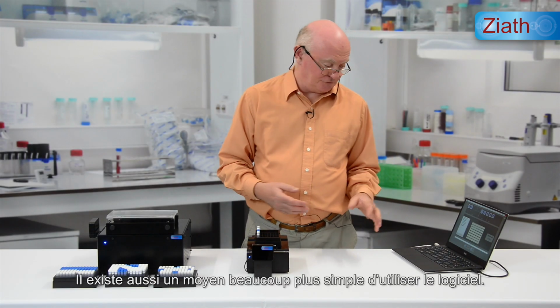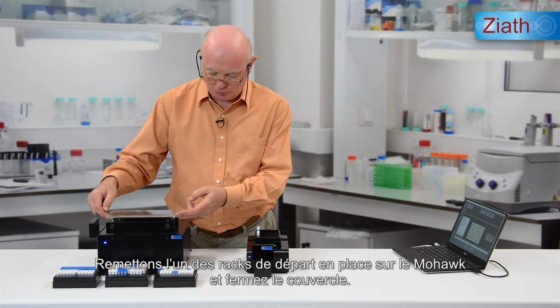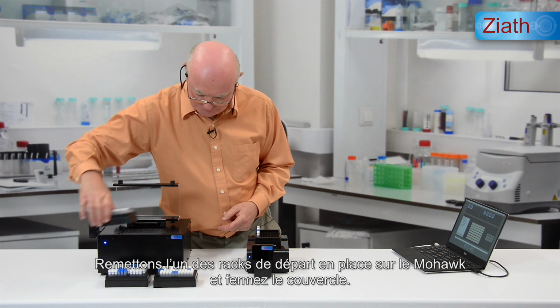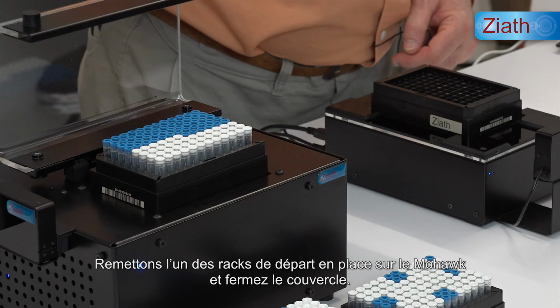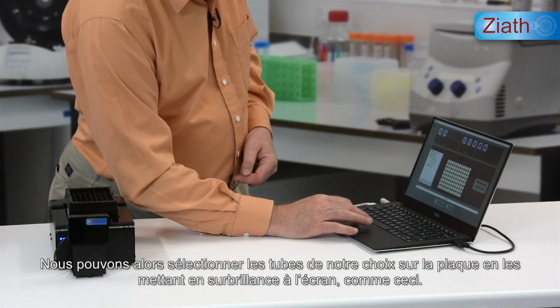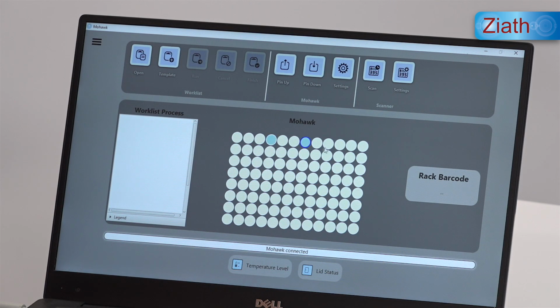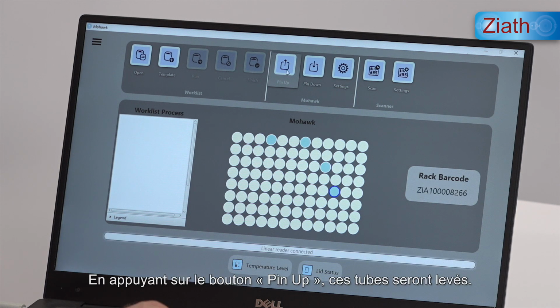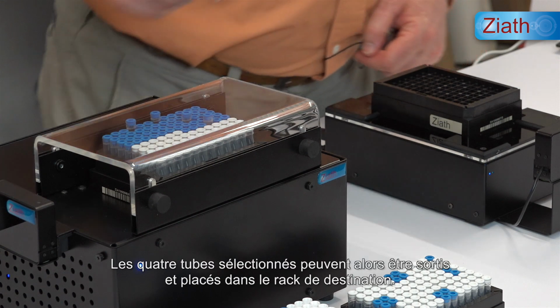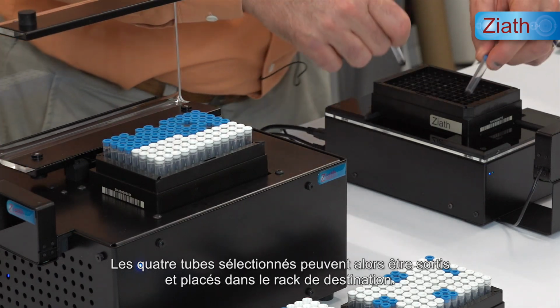There is also a much simpler way of using the software, and that's to manually pick tubes simply by entering them. So if we put one of the original racks back on, if we then close the lid, we're simply going to randomly select some tubes across the plate. They'd be selected by highlighting them on screen like this, and then pressing the pin up button will raise those tubes for picking, and the 4 tubes which have been selected can then be removed and placed in the destination rack.